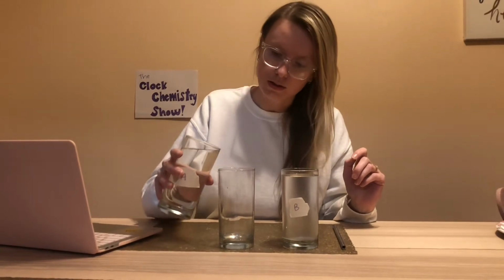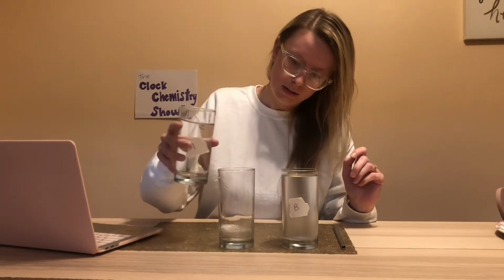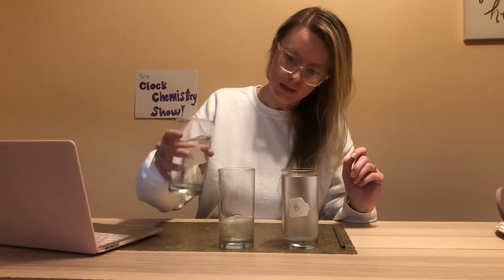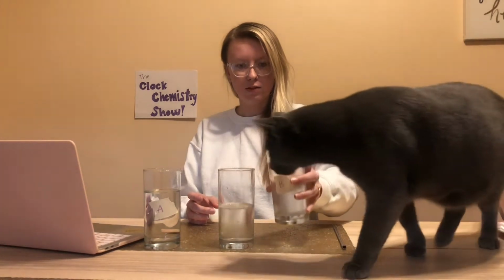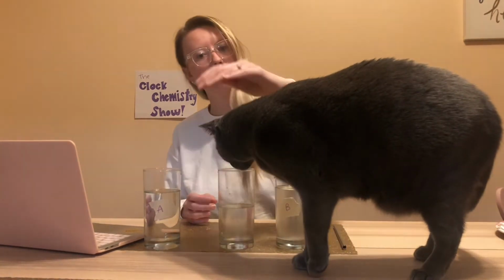We're going to mix together equal-ish amounts of the solutions. So here we got solution A. Solution B.